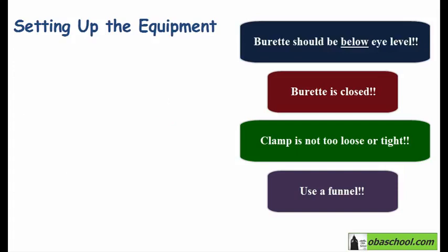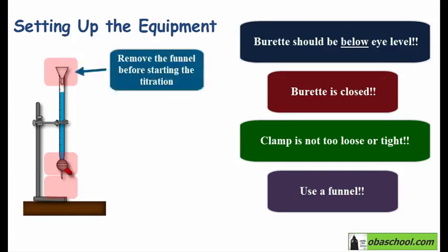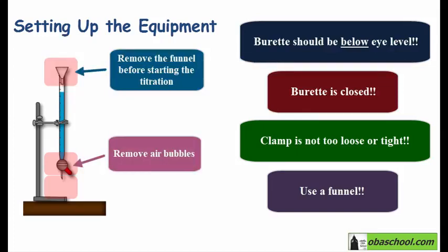So before starting the experiment, you have also to make sure you remove the funnel, because if any liquid drips from the funnel after you have started the titration, errors will be introduced in your measurements. So you have to remove the funnel to make a good reading of the volume, which we will discuss later. Also, there may be an air bubble in the tap or in the region below the tap. We will run through some of the solution just to clear any bubbles if present. And of course, make sure to add a small beaker to collect any run-through from the burette, and then you will add your conical flask.